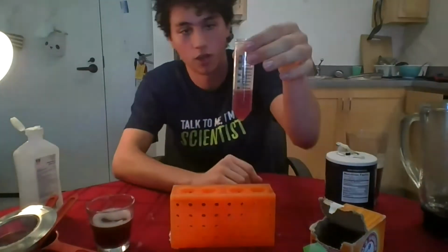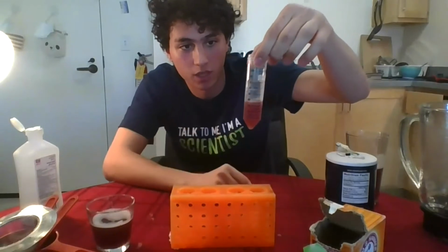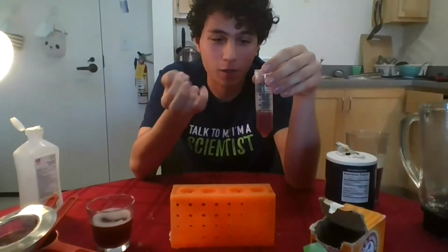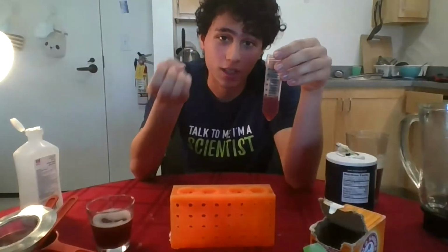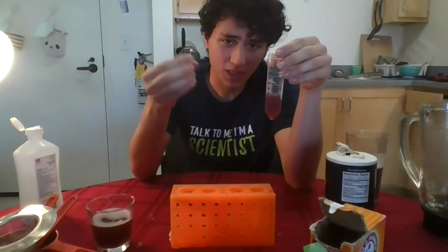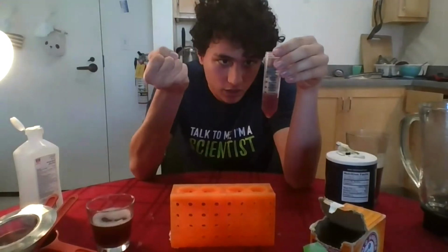And that is it. So I've added two layers. You can see in contrast, there is one layer of alcohol and then there is one layer of strawberry. And so I'm just going to let it sit there. And as this happens, you should be able to start seeing a cloudy, foggy mist coming out of the strawberry blend. And that, believe it or not, is the DNA that's coming out from the strawberry blend. It was dissolved in the strawberry, in the red part of this test tube. And now as it encounters the alcohol, it's aggregating. It's becoming cloudy chunks of DNA.